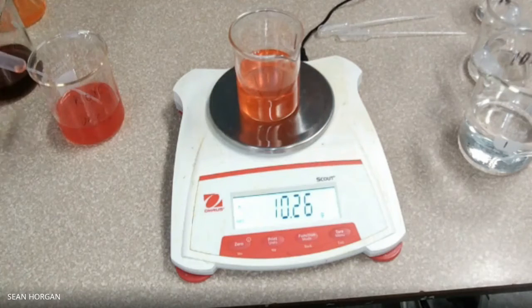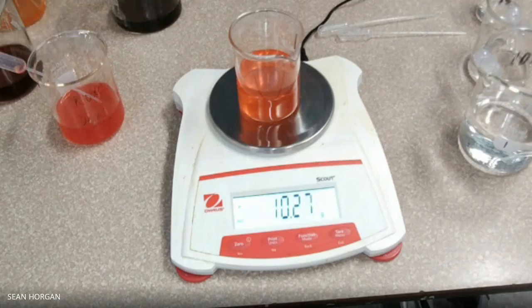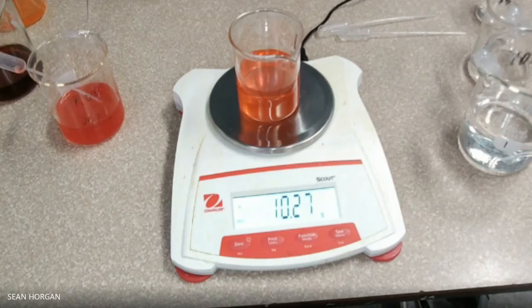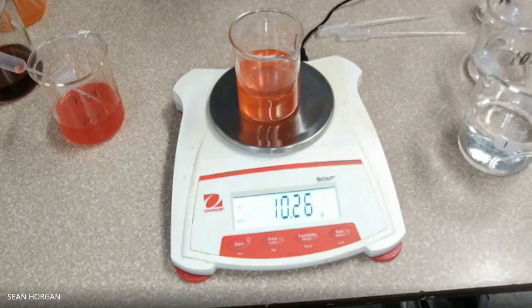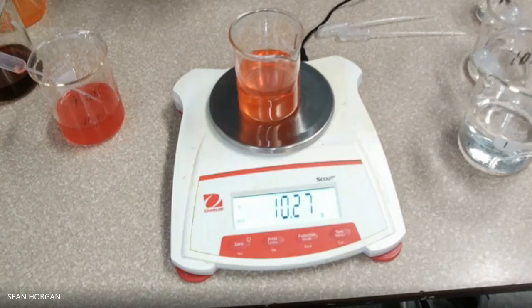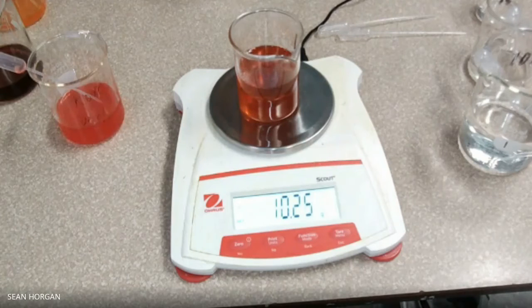And then we'll do the Coke. We got some Coke here. Bottom of the meniscus here — there's the Coke.